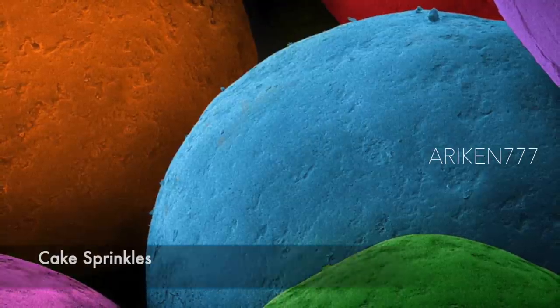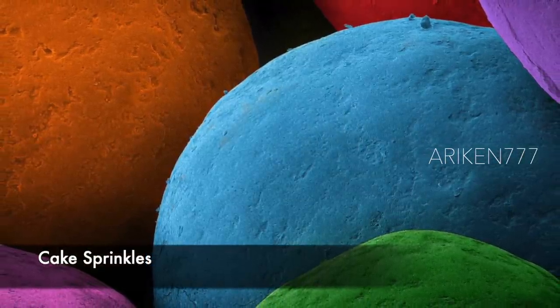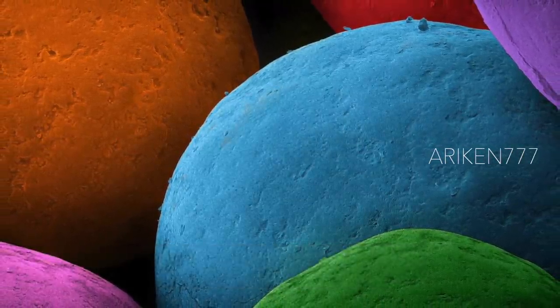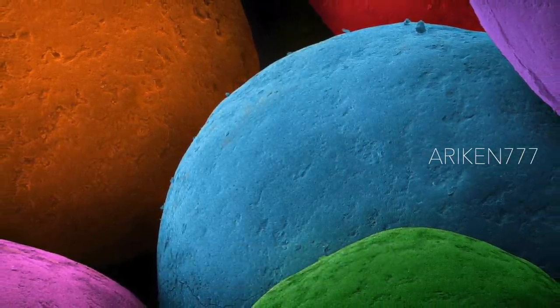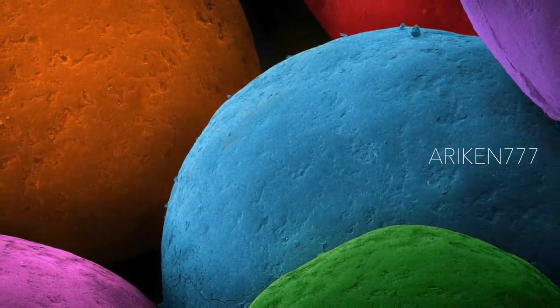Cake sprinkles, which are made from corn syrup, sugar, corn starch, wax, and artificial flavors and colors.